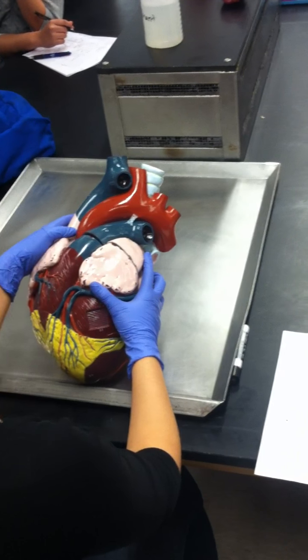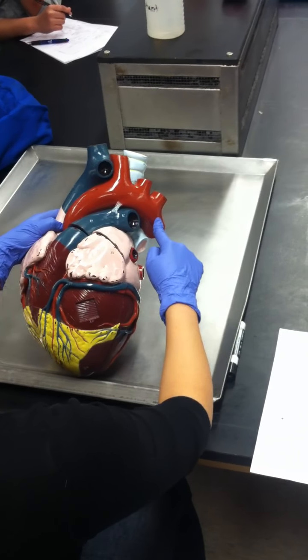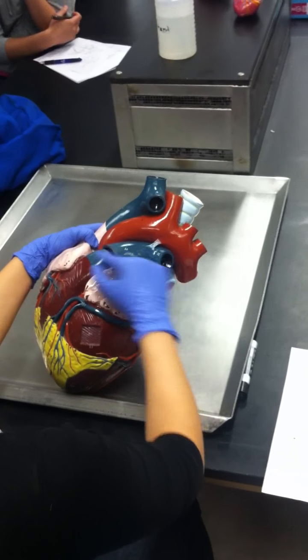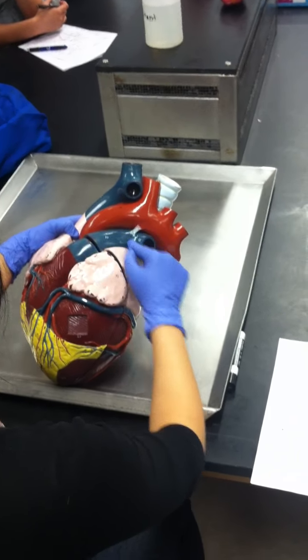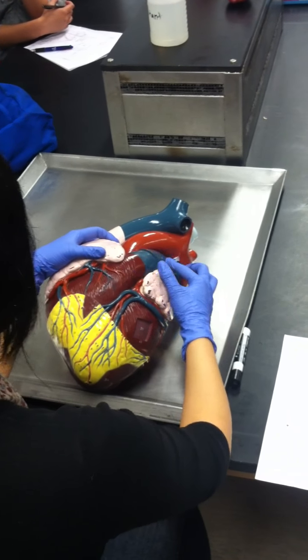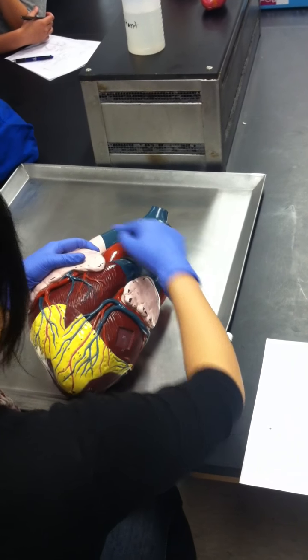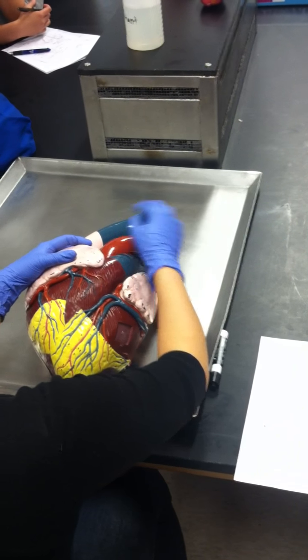So the big blood vessel that's coming out of the heart, this big red one, was the what? Aorta. Right? The first one, right? Do you see this blue one in the bottom? This one? You have to know the order. So this first one is the pulmonary trunk, right? And see how it's blue because it's carrying what? Deoxygenated blood, right? Pulmonary trunk. And then this is the aorta. And then this one is the superior vena cava. Okay, so that's the order.